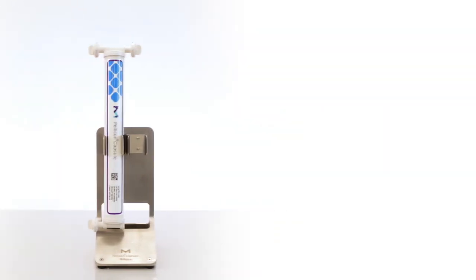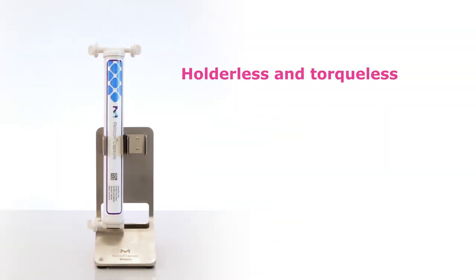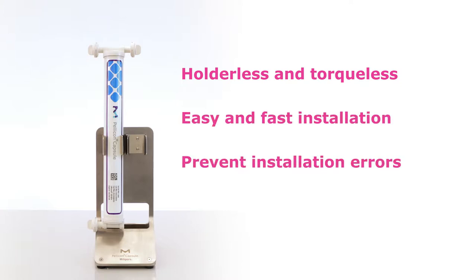The capsule does not require a compression holder, torquing, or other installation hardware to seal the flow path, simplifying installation and preventing errors that could cause leakage or damage to the device.